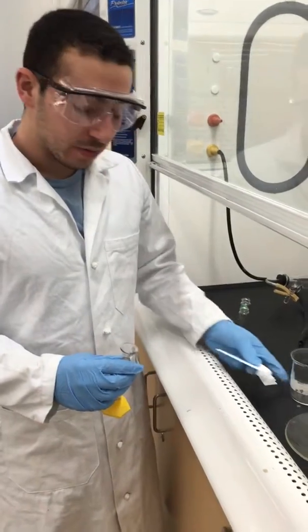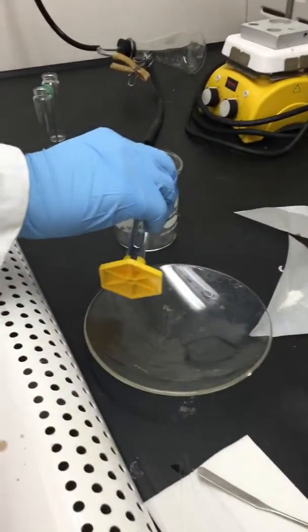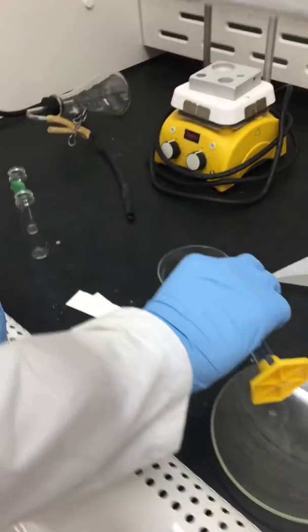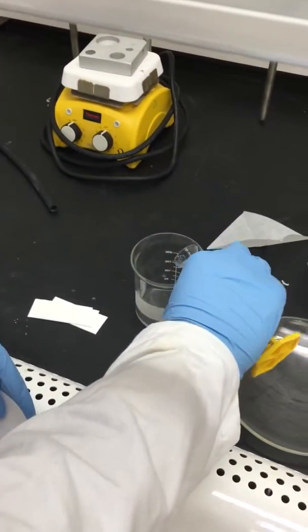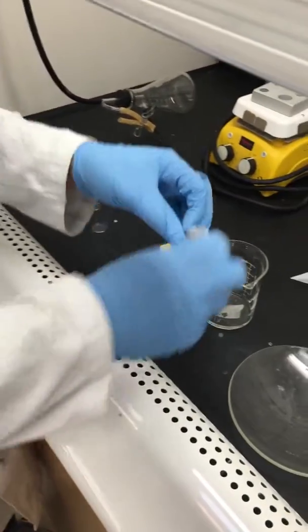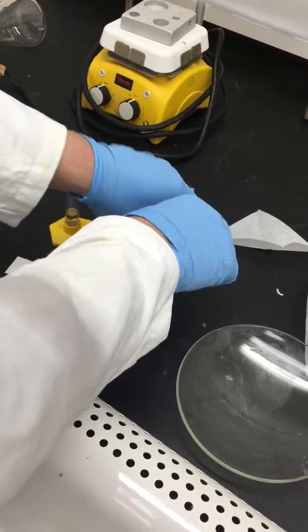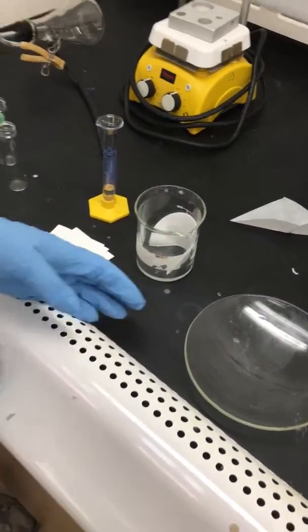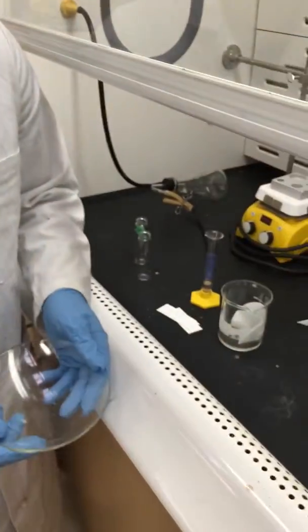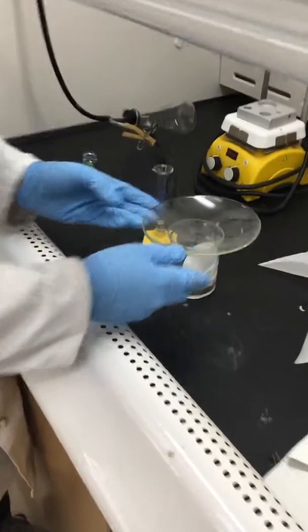So in the chamber, you put a thin layer of the 2:3 ethyl acetate hexane. It should just be enough to cover a little. And then you take the filter paper, you fold it in half like this, and you put it on the side. Now, the 2:3 ethyl acetate hexane mixture is very volatile and will evaporate quickly. So while you do the rest of the procedure, you put a watch glass over it to cover it up.